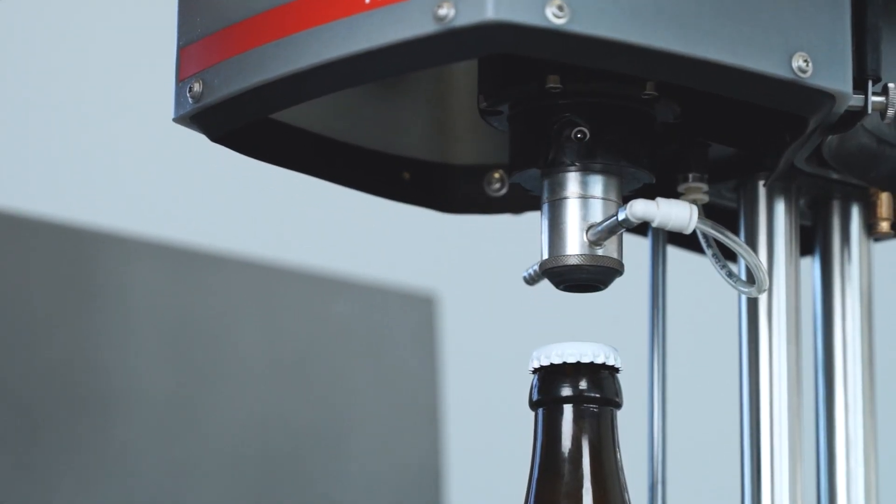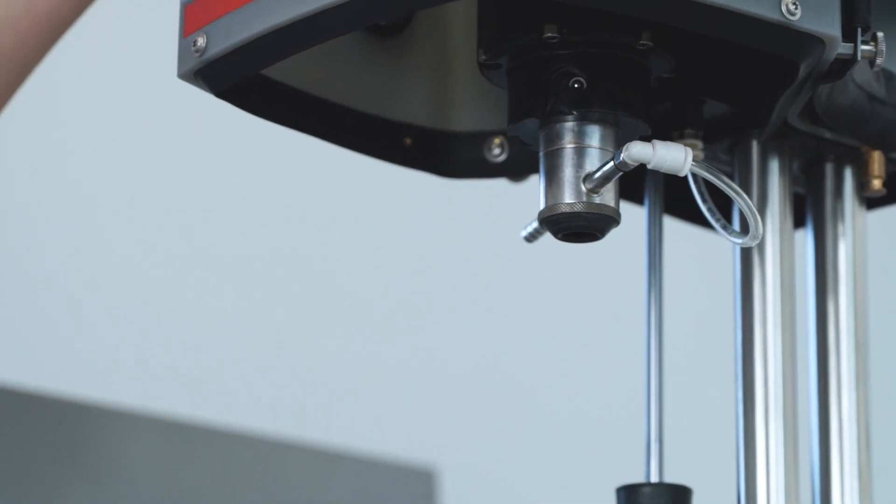In case you are going to change the package type for the next measurement cycle, you might need to change the height as well.